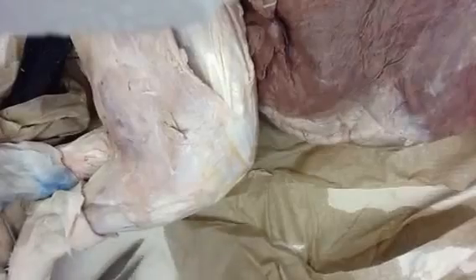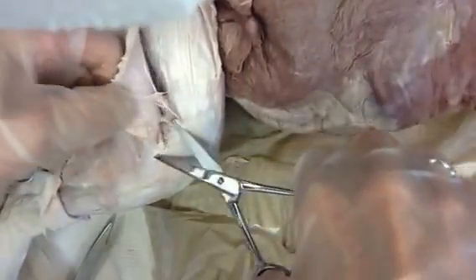The other thing we want to show — we're going to flip our cat around. Did you look for the sciatic yet? No. So we're going to look for the sciatic nerve right underneath these hamstring muscles. I'm just going to go ahead and snip some of this hamstring.